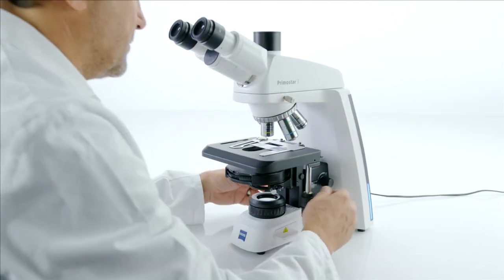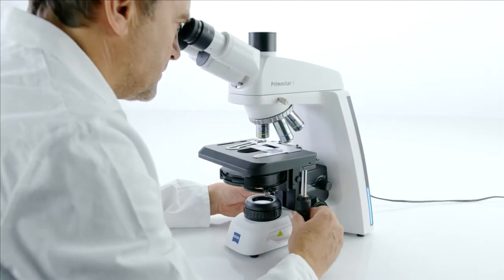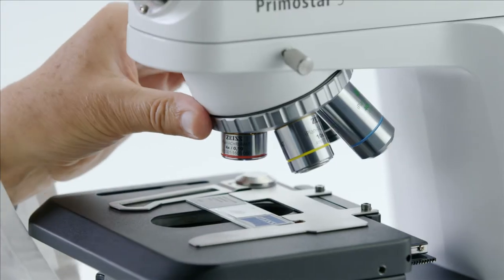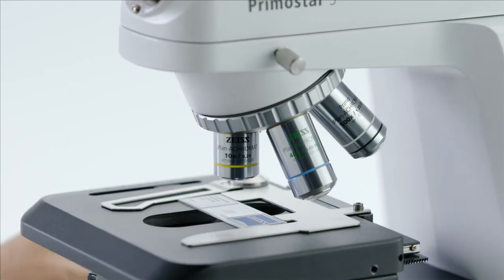You may have to look at each specimen with two or more objectives, and so normally you will be adjusting the amount of light over and over again to suit each lens.